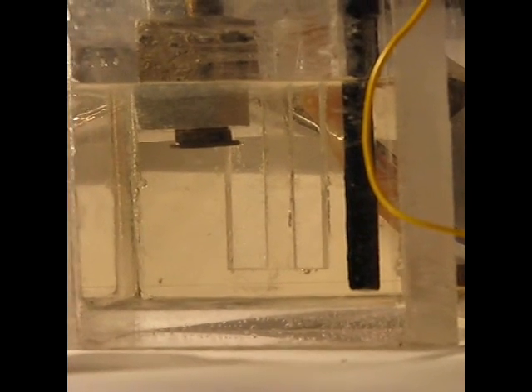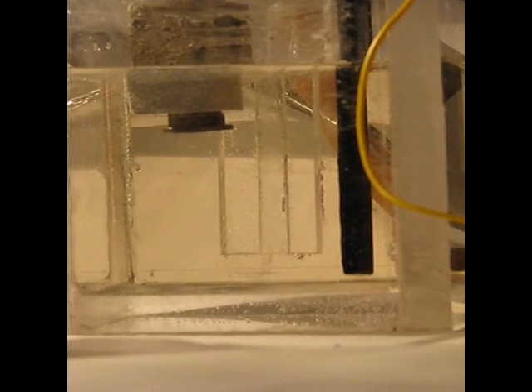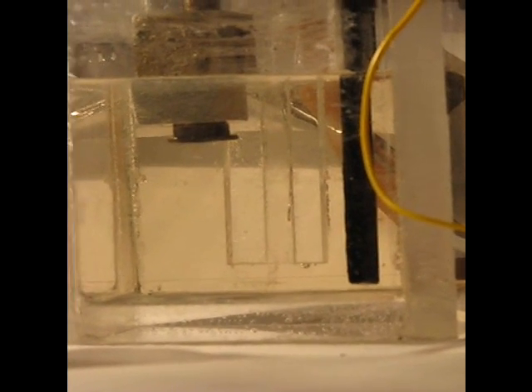This will build with time and be at a significant rate. We can control the rate by the concentration of the chemistry, also by temperature. We're at 66 degrees Fahrenheit.